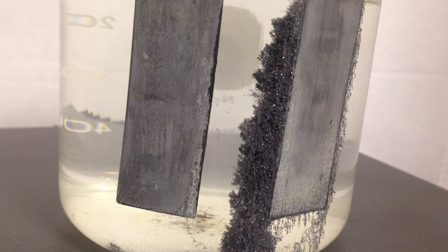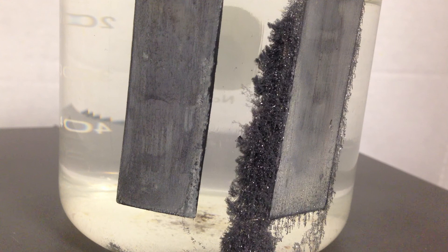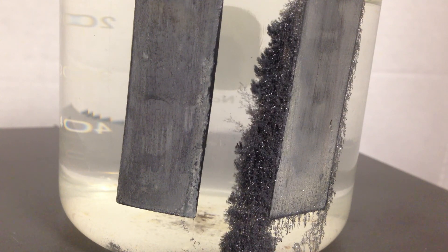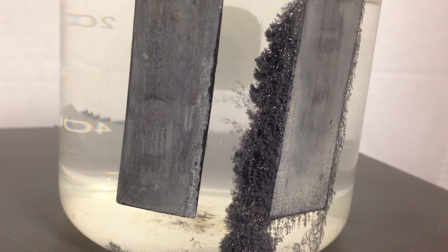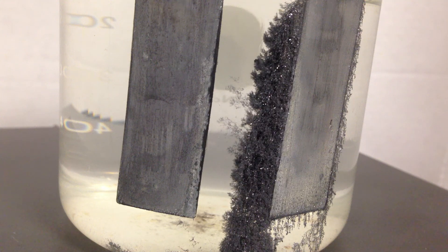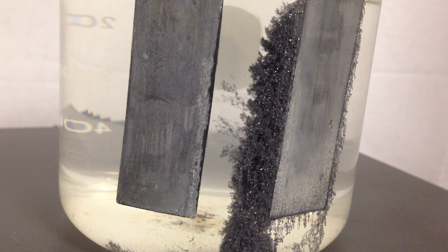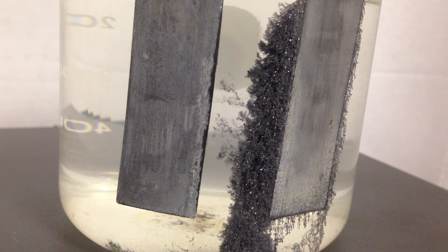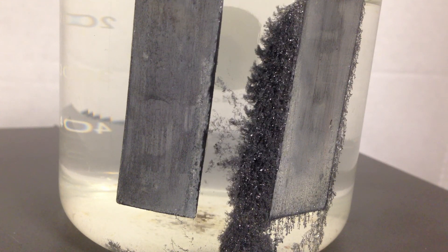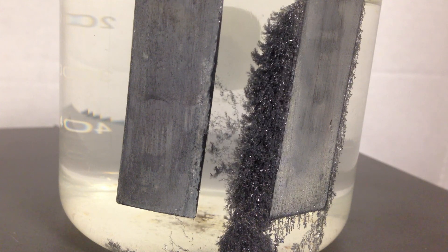If you look at the corner of this electrode you can see it getting smaller, and you can see something dissolving — look very carefully at the corner. On the right, you can see the crystallized form of lead; notice how it's shiny with some luster. It's not true electroplating, but you can clearly see the cathode on the right where plating is occurring, and dissolving on the left electrode. Hope that helped.